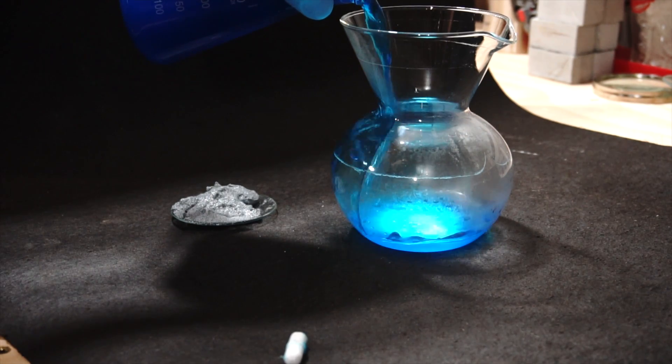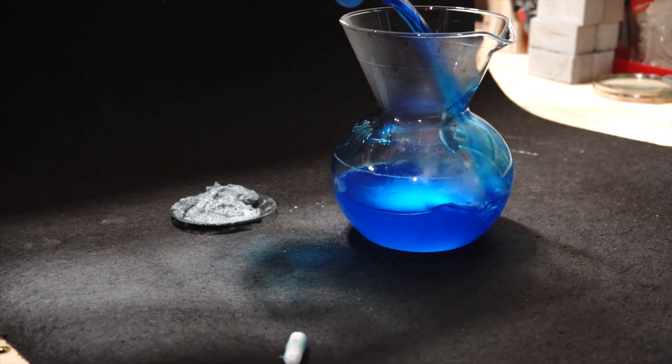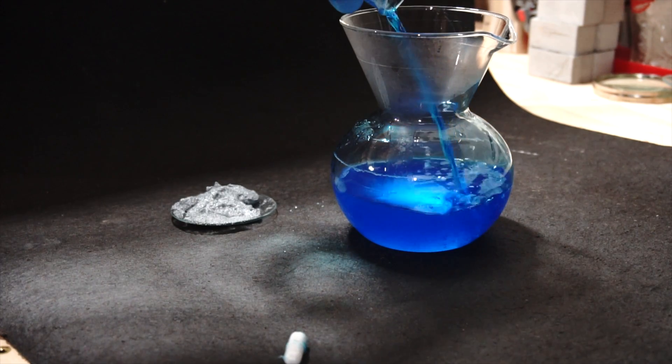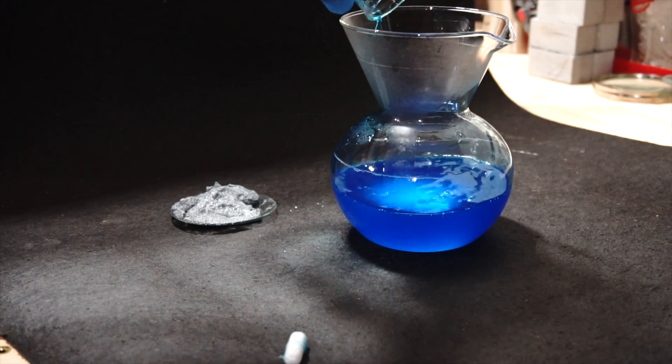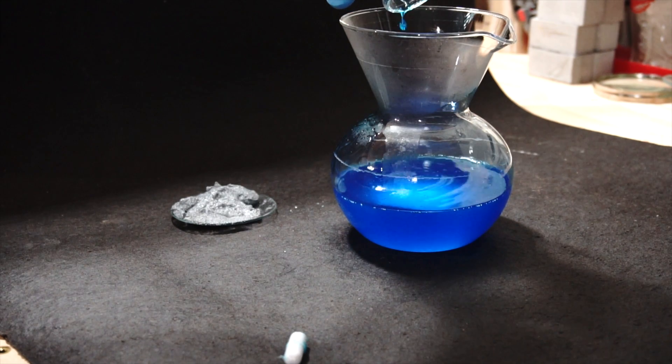Check out that gnarly shade of blue. That's pretty sweet. So believe it or not, there's actually copper metal right here in this blue liquid.